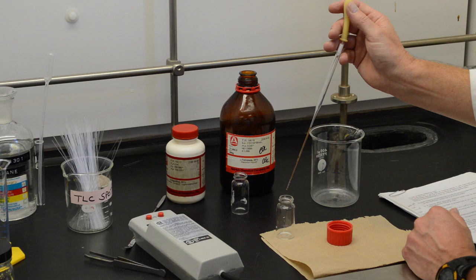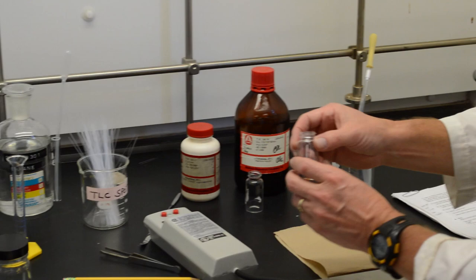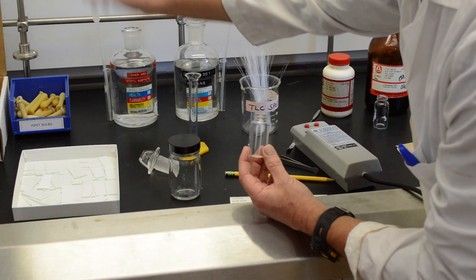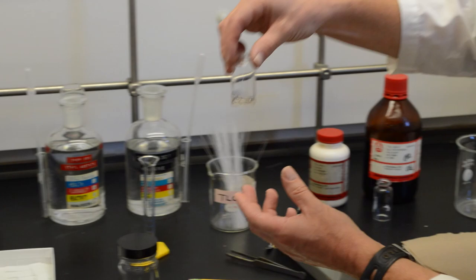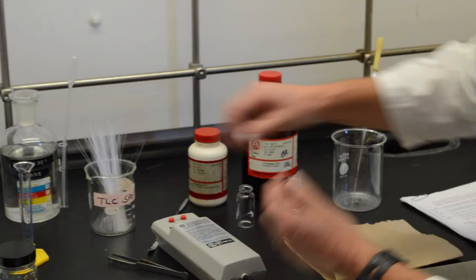And then, with this vial, we want to dissolve the liquid into a suitable solvent and ethyl acetate is a good choice for this. So we will put a squirt of a milliliter of solvent and ethyl acetate and dissolve that sample. And I will label that as sample A.